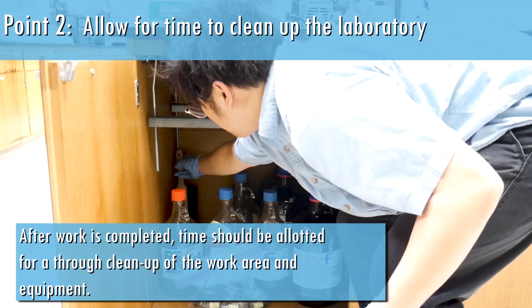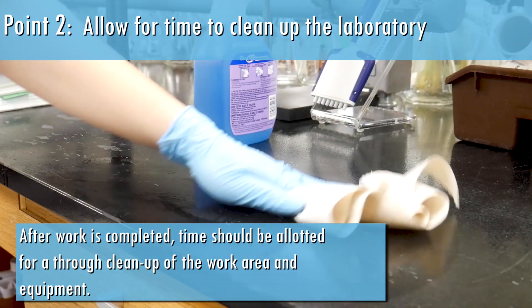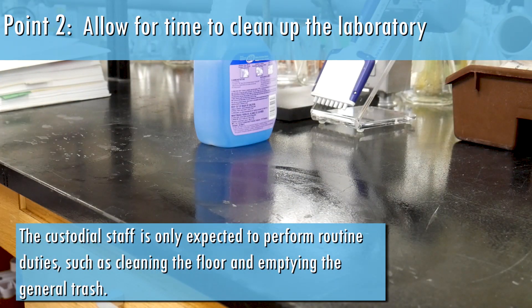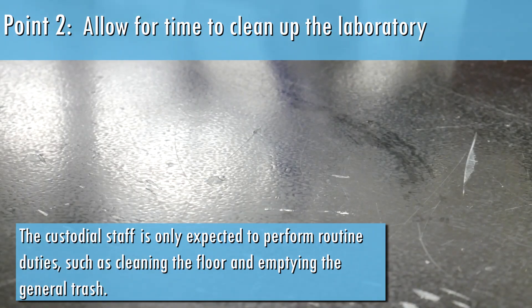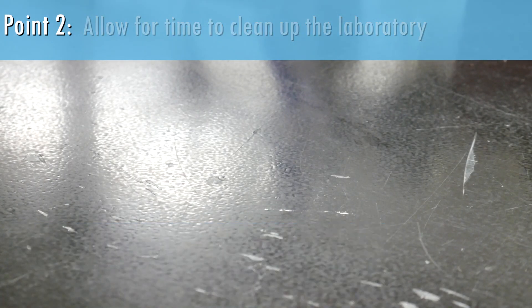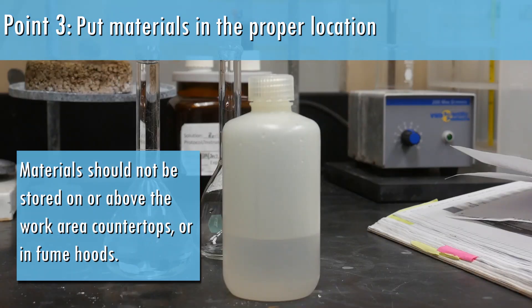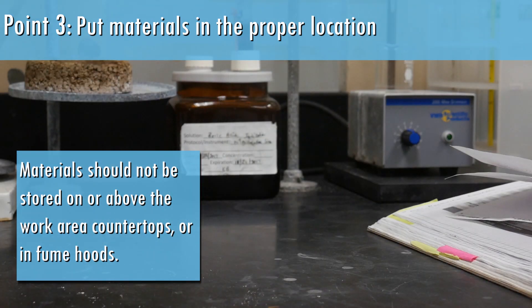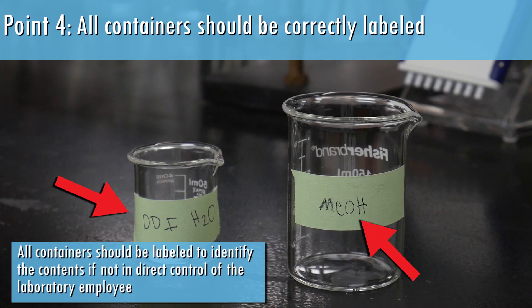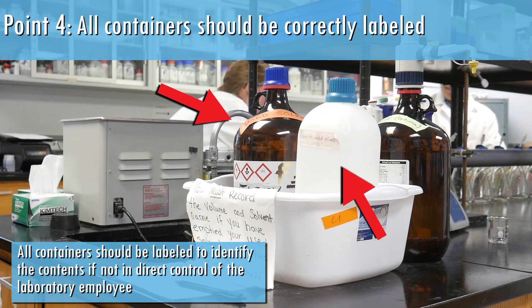After work is completed, time should be allotted for a thorough cleanup of the work area and equipment. Materials should not be stored on or above the work area countertops or in fume hoods. All containers should be labeled to identify the contents if not in direct control of the laboratory employee.